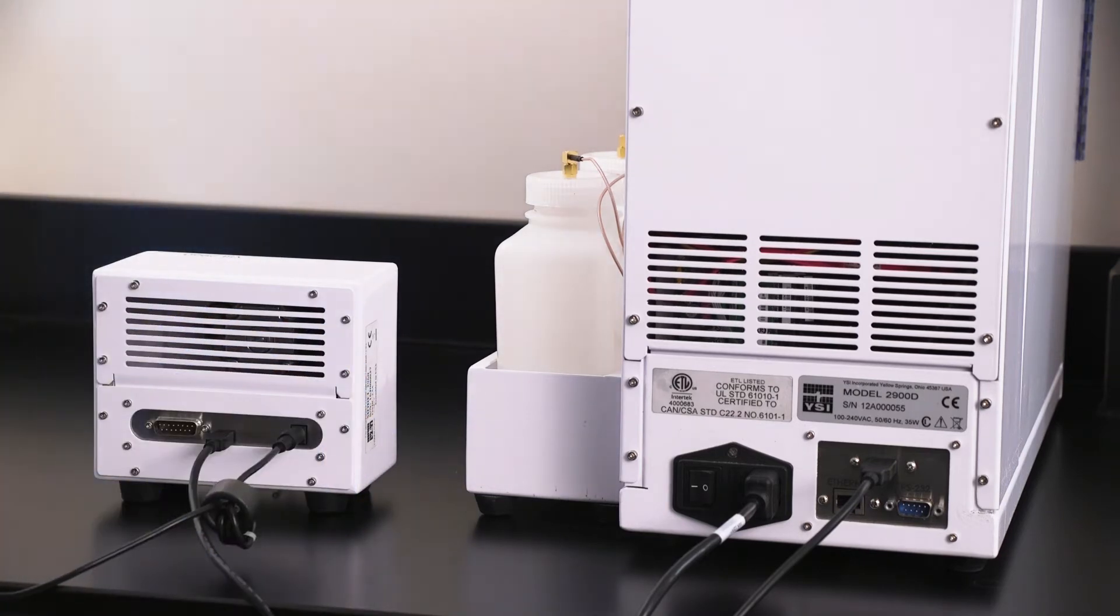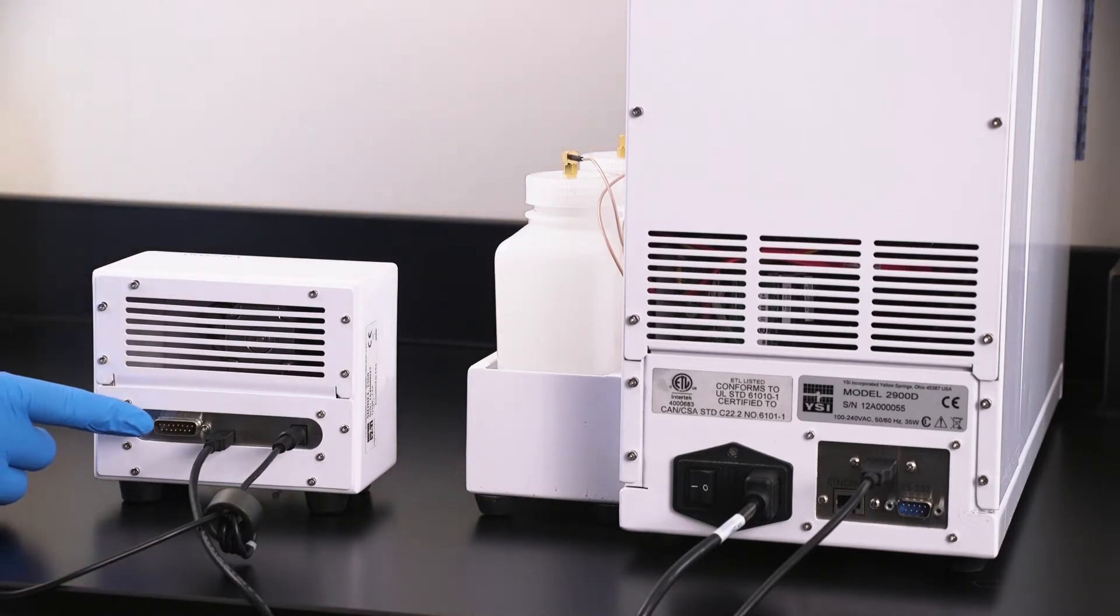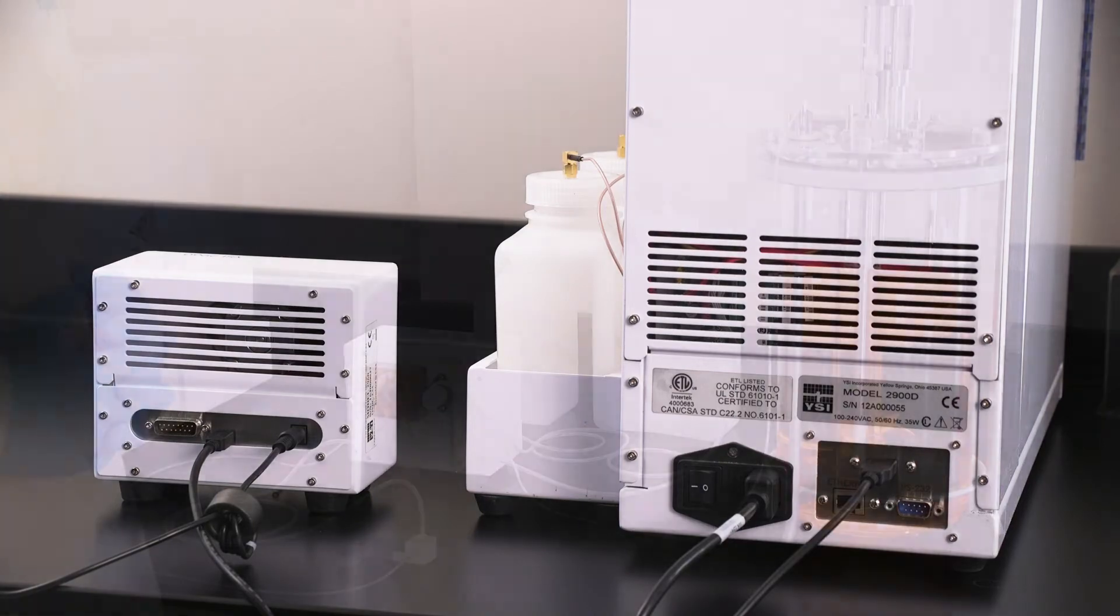If you are controlling a bioreactor and would like output for the instrument, connect the analog output cable to the back of the online monitor and secure to your controller or computer.